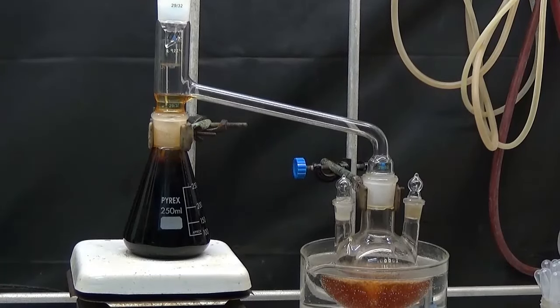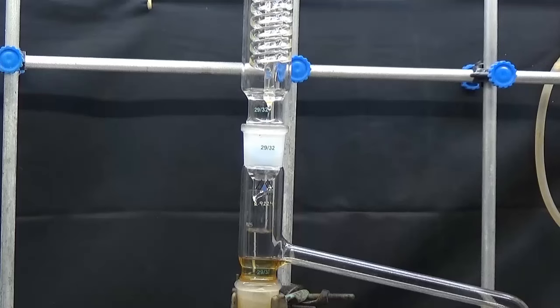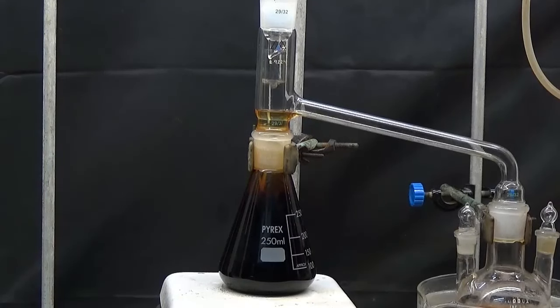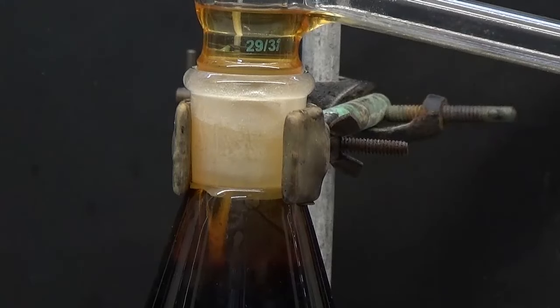We heat the water bath. Ether vapors are observed to condense and drop into the central funnel. The extractor flask is kept under gentle stirring so that the aqueous phase does not pass into the evaporation flask. We only release the condensed ether that transports the furfuryl alcohol.